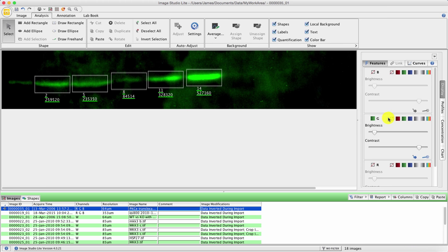look a bit prettier. So if you've selected just the G, the green channel, over on the right here you've got an option of how you display. This is rather like using a confocal microscope or one of these other pseudo color applications. You can click on one of these different boxes to show the scale it's been shown with, and I'm going to click on this one on the end, and there we are. Our Western blot now looks much more like a Western blot, and you can read these numbers off the screen that give you the densities of each of these bands.